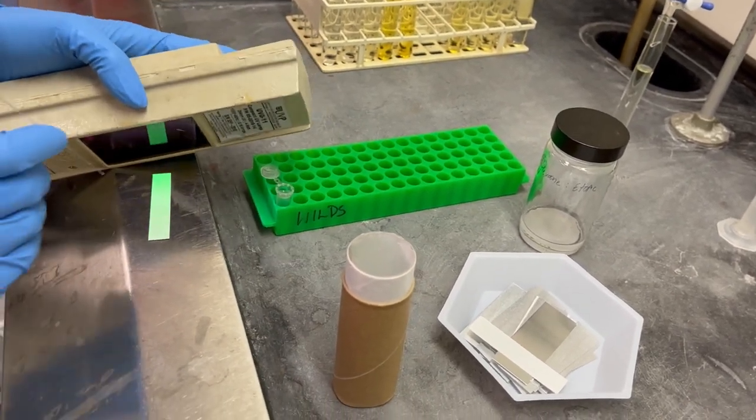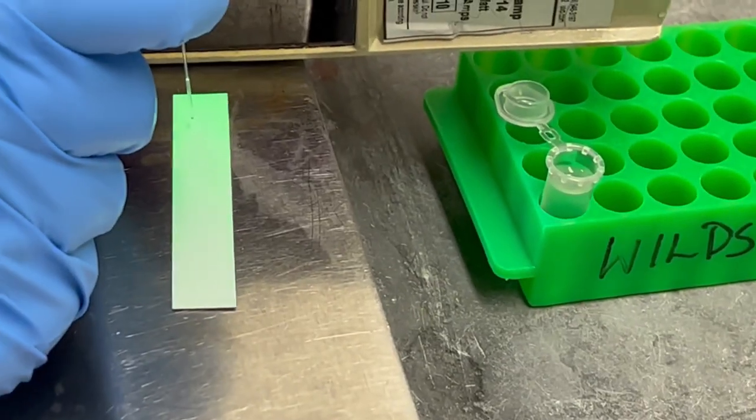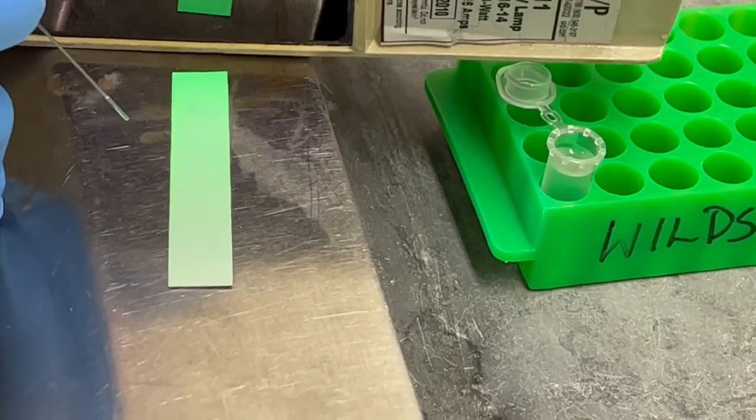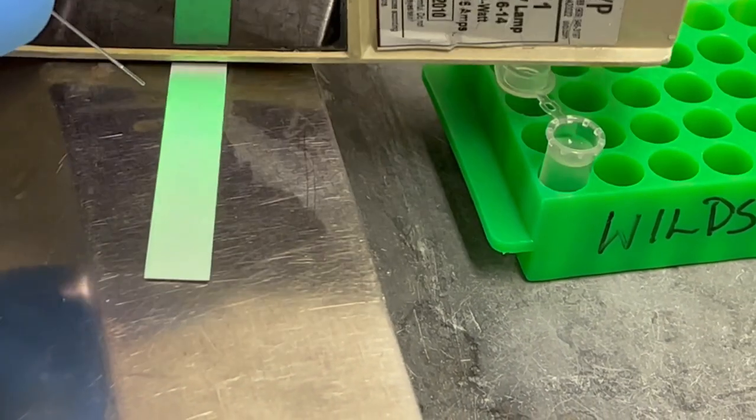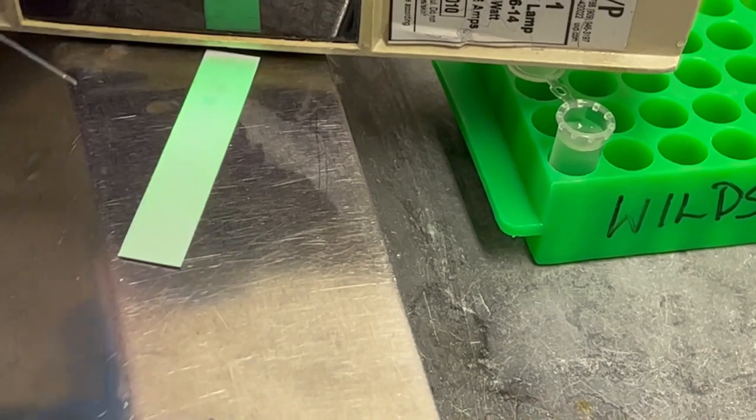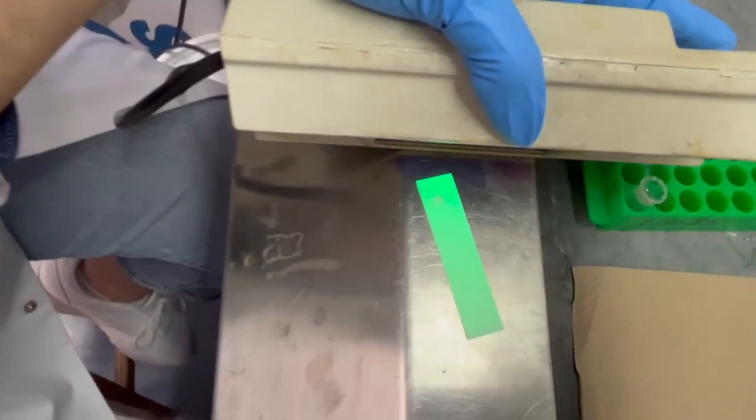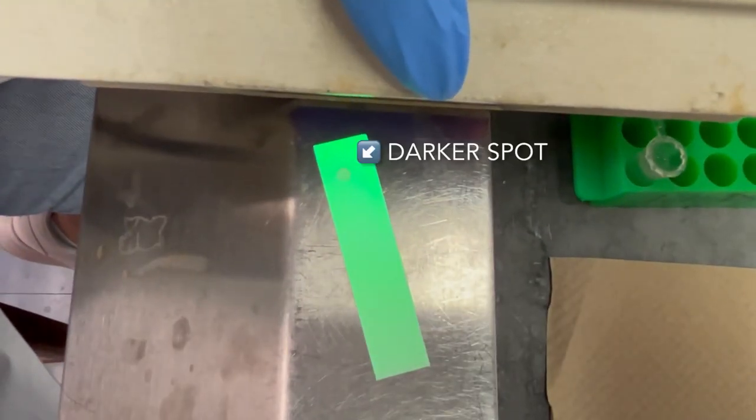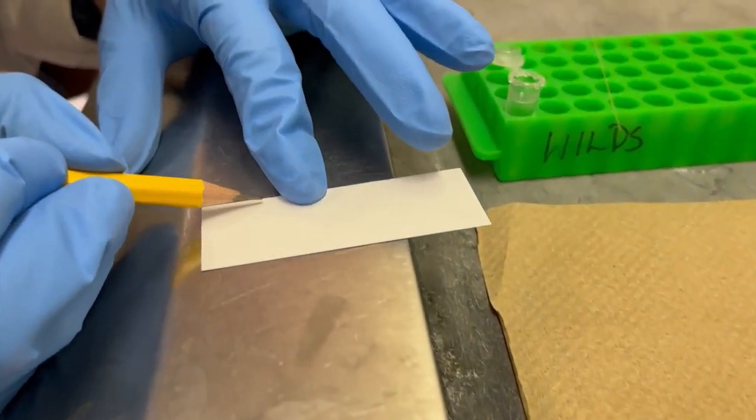Due to the nature of the research in our lab, the majority of our products are fluorescent under UV light. The tubes are sampled in order of collection and checked under UV light. If the product is starting to come out, a darker spot will be observed on that TLC plate.